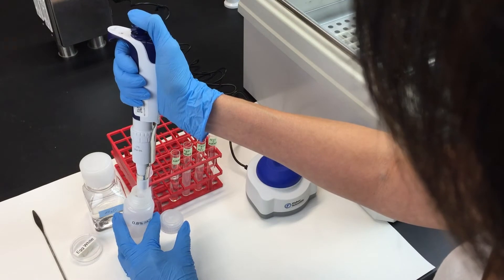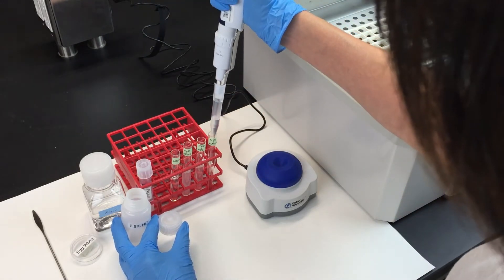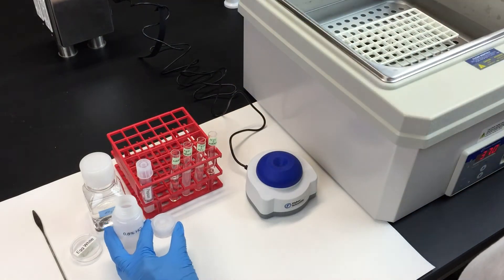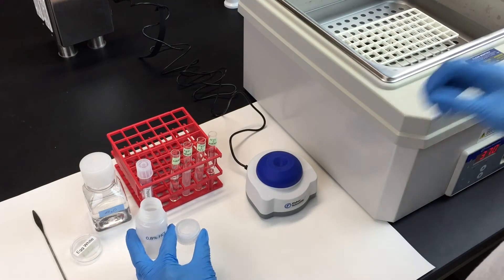The last test tube will have 2.5 milliliters of hydrochloric acid solution and 2.5 milliliters of water.